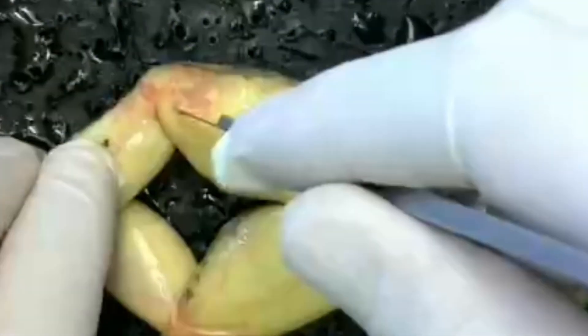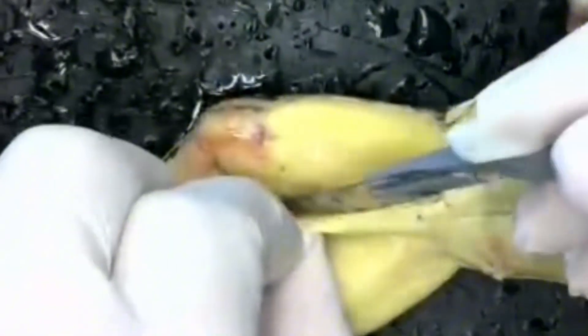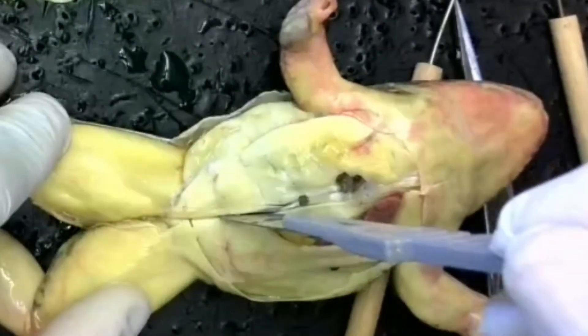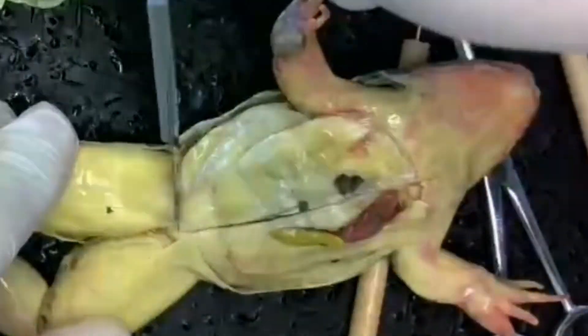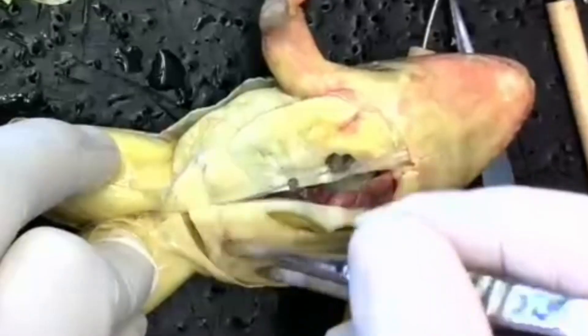Now we have access to the muscular system. You can also look at the muscles on the hind legs — notice that the muscles on the frog's hind legs are very muscular. We're going to make an incision along the abdomen, then use forceps to pull away the muscles and muscular tissue with the scissors.